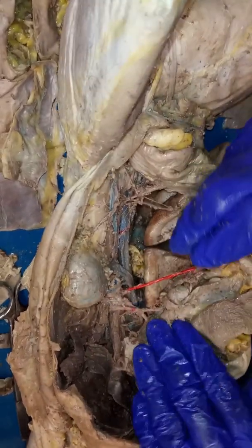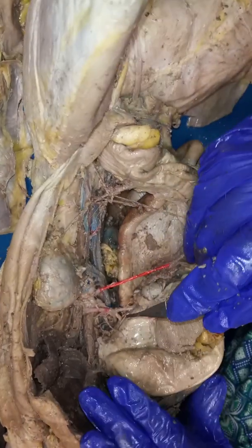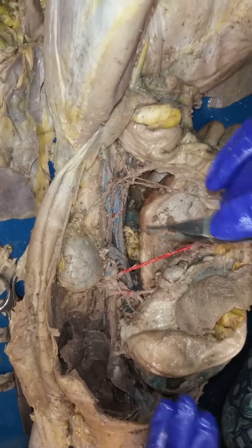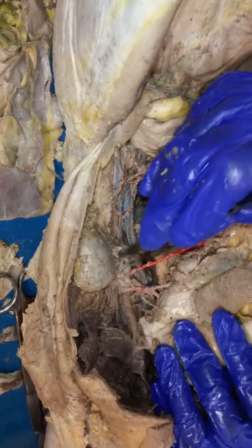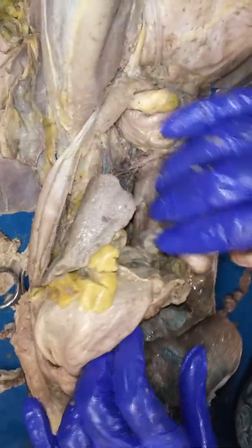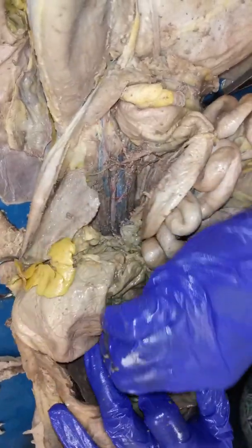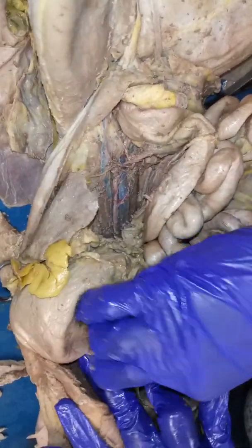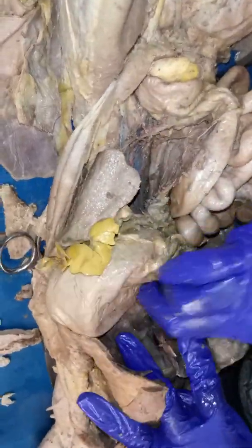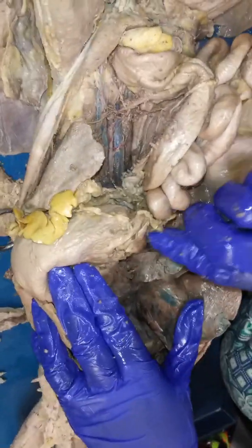And what are other ones that we can look for? Okay, here, this is what's a little bit tricky in that there isn't an inferior or superior mesenteric vein that's very clear cut. You would have to have vessels that are going to be draining into the hepatic portal vein. The hepatic portal vein is a little difficult to find here because it would be very, very thick, and so that's one of the ones that we haven't been able to kind of dissect in all the way. But at the very least, we can see those.